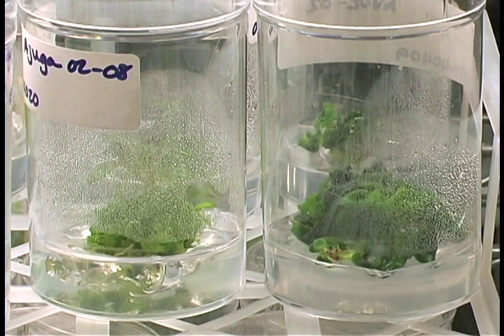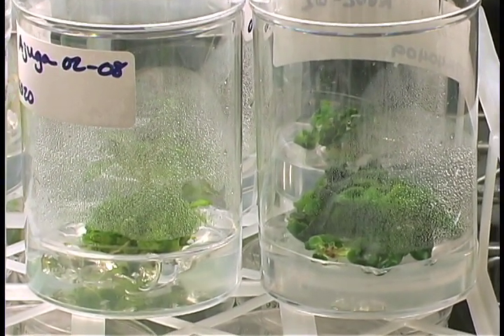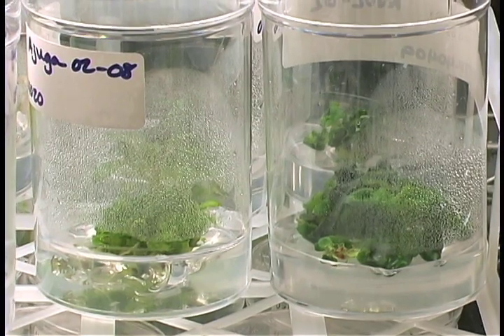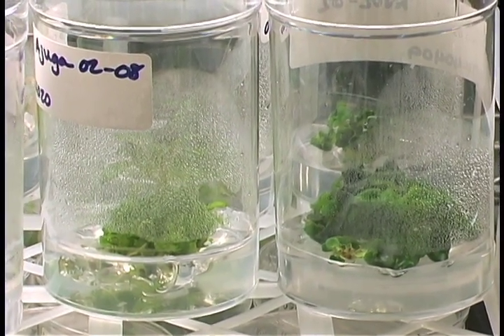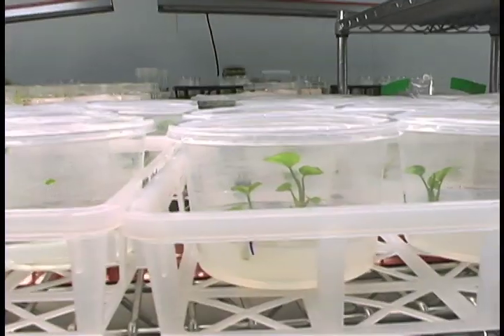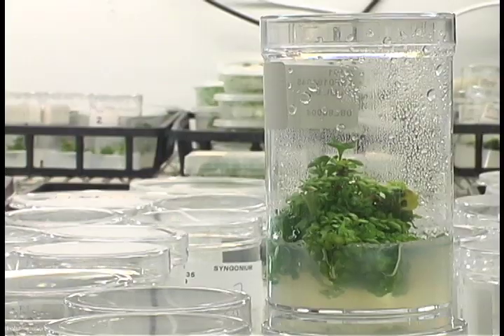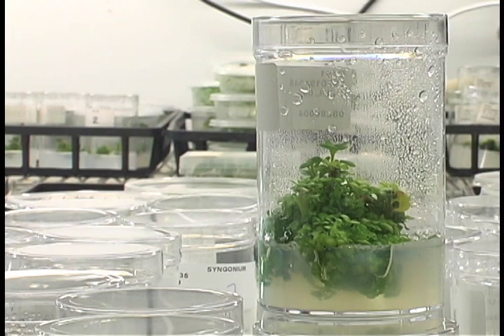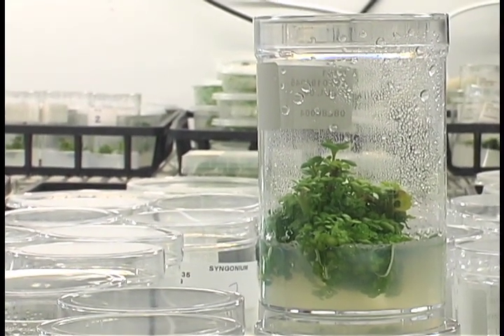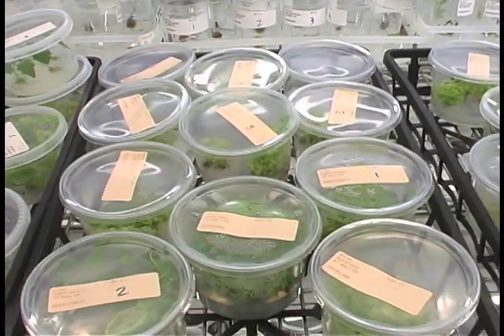Our aim is to surface sterilize the plant tissue and put it on a sterile growth medium without any bacteria or fungi getting on the plant or medium. This is not easy because bacteria and fungal spores are in the air, on us, in us, and under us. When you see sunlight shining in a window, you can, from certain angles, see dust particles in the air. There are hundreds of bacteria attached to each dust particle.